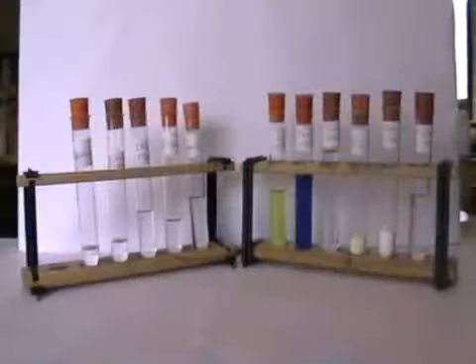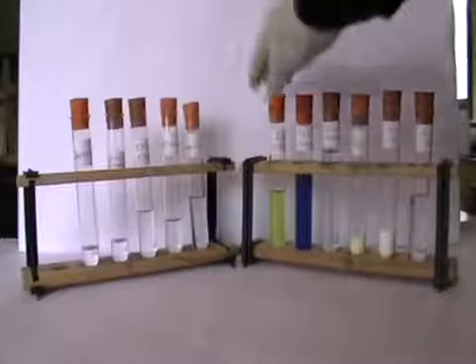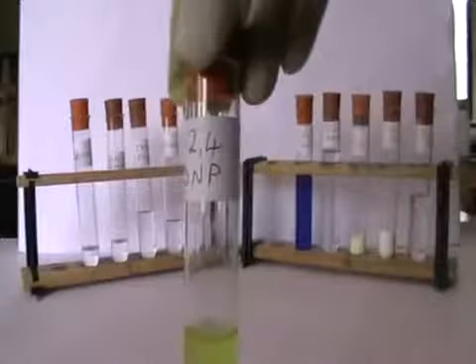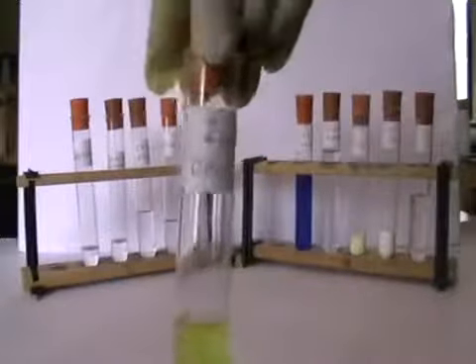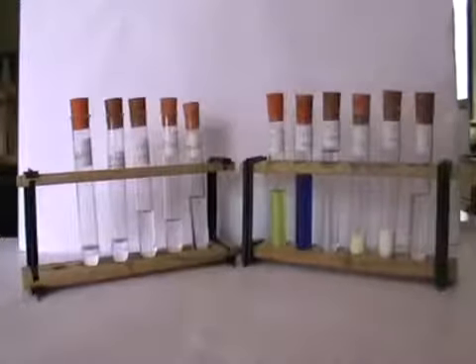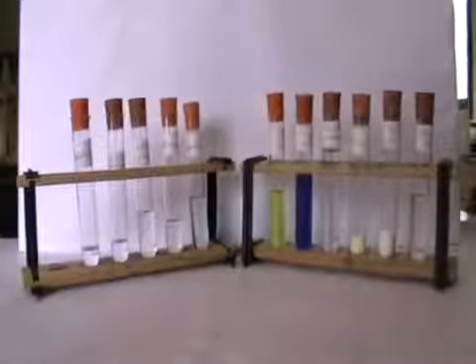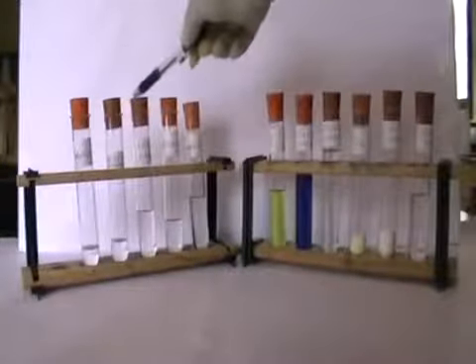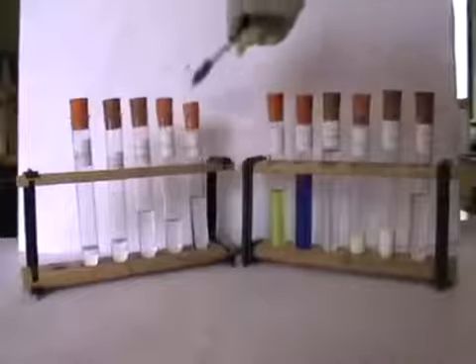In this case we're going to do a reaction with this chemical. This is 2,4-DNP. The DNP stands for dinitrophenylhydrazine, a very large molecule. We'll add 2,4-DNP to each of these 5 organic chemicals: ethanol, glacial ethanoic acid, ethyl ethanoate, ethanal, and propanone.